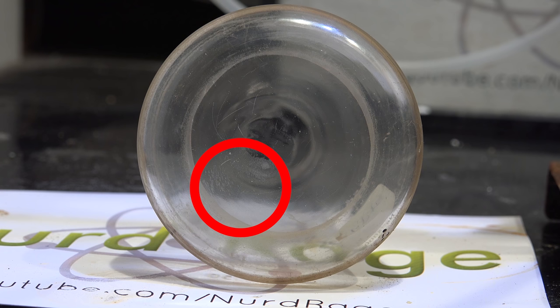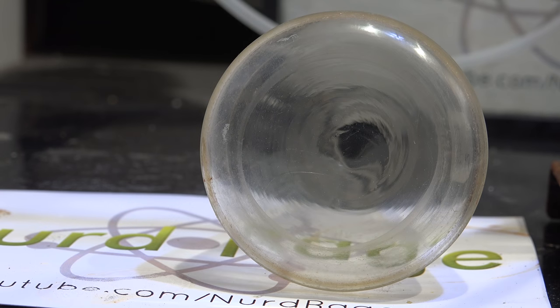Nonetheless, while the aluminum is not as good as sodium, it's still a very good drying agent compared to magnesium alone. This level of damage is acceptable in my opinion as the flask is still fully functional. But can we do even better than this? Let me get another flask now.